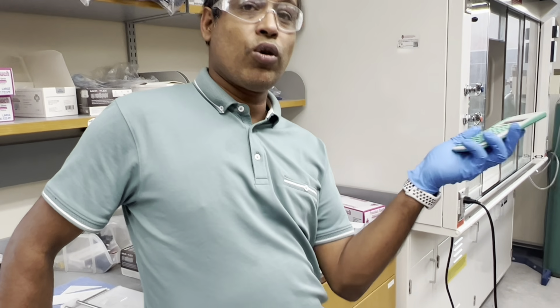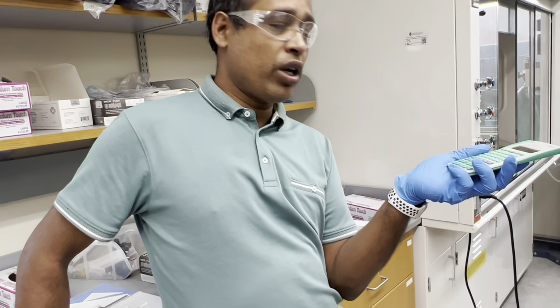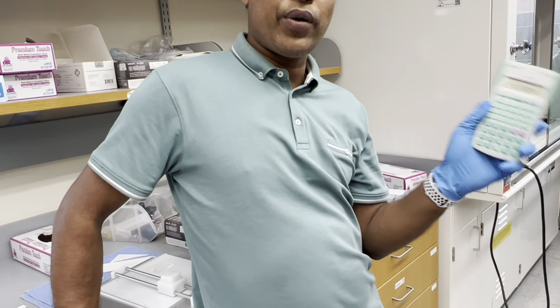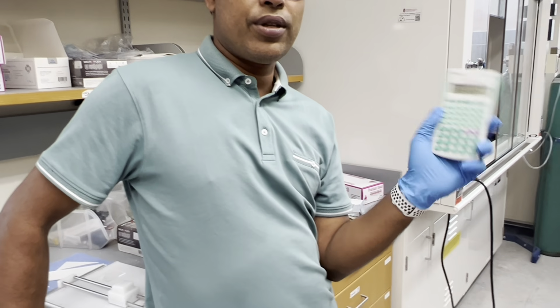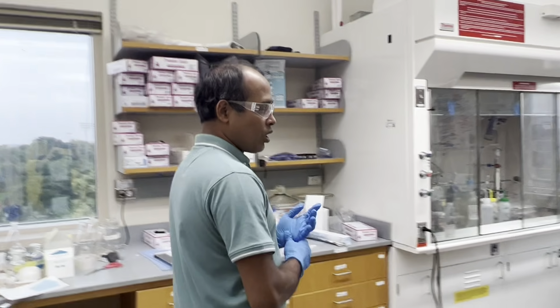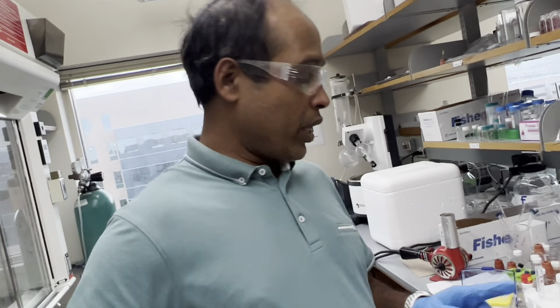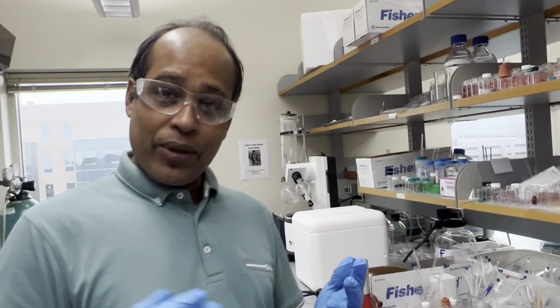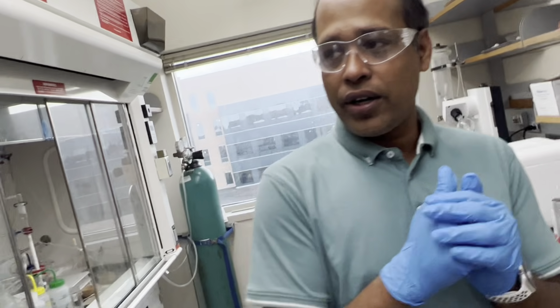So ultimately that solution will go to the water and we are adding HCl with the water. So that water we can reduce there, but we need to have the 5% of DMSO. So the required DMSO should be there. Okay. You get it? So here, we need 490 microliter of the DMSO, but to adjust the acidity with the HCl, we added 30 microliter of the HCl solution. Oh no, you're saying the 490 was in the calculation already? Yeah, in the calculation, to get the 5% DMSO. Oh my god. Okay. Yeah, you have to keep those things in mind. You have to be very subtle with the calculation. Okay.